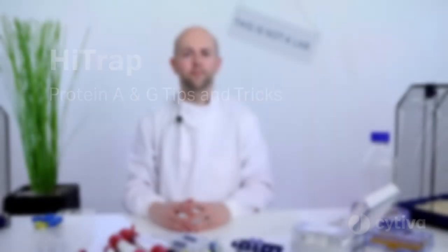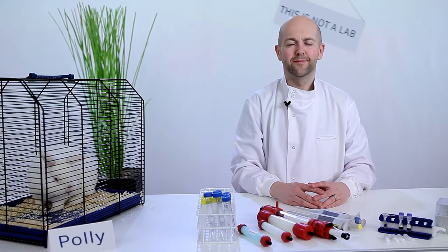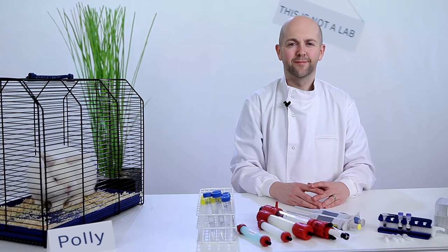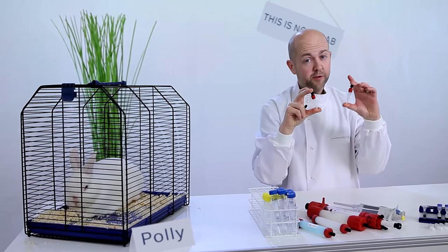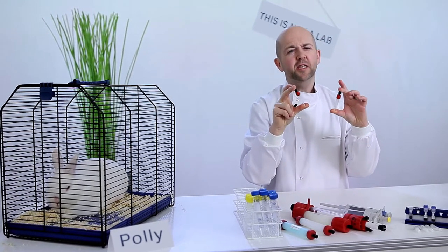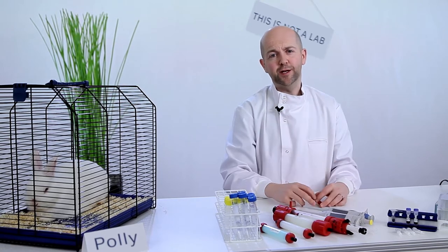Antibody purification is simple with HiTrap Protein A and G antibody purification columns, making it easy to purify polyclonal, monoclonal, and genetically engineered antibodies from samples such as serum, ascites, and cell culture. Mike is going to focus on optimizing antibody purification with the HiTrap Protein A and G formats. HiTrap Protein A HP and HiTrap Protein G HP columns are simple to use, easy to scale up, and will simplify your antibody purification.